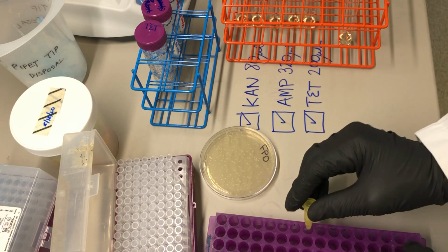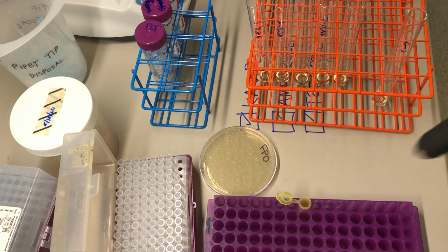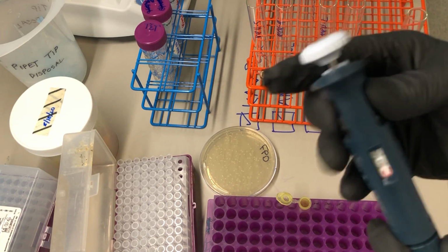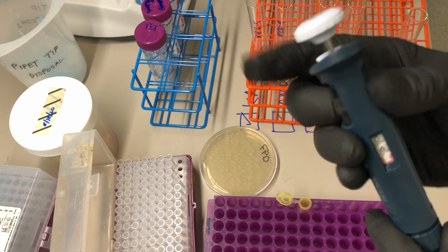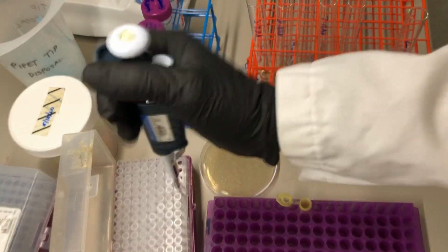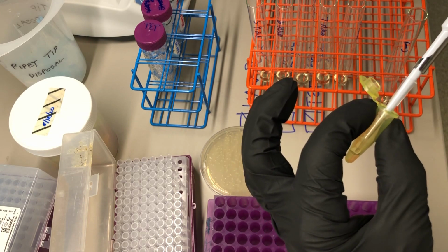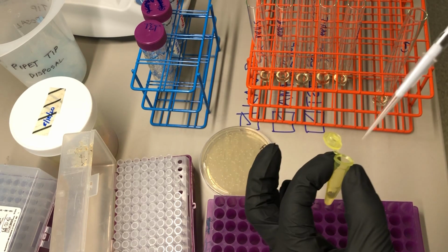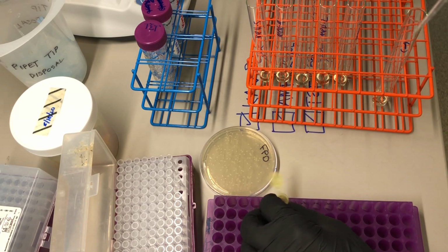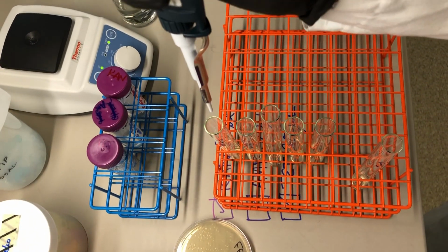And now we're going to use what we call the dirty tip method for moving some of these cells into the culture tubes. For this, I need the P20 device, and I'm going to dial in 10 microliters. This is the smallest pipetting device. And now we pipette up and down the 10 microliters. And then instead of taking the 10 microliters, we push the liquid out so that the tip is actually empty. But there are some cells sticking to the plastic, and then we eject the tip into the tube so that the cells get carried to the bottom of the tube.